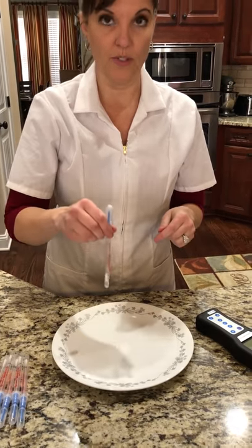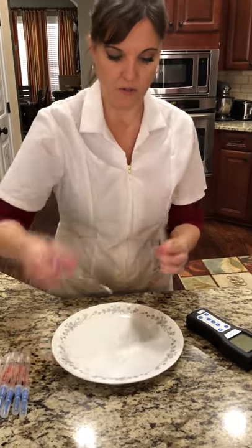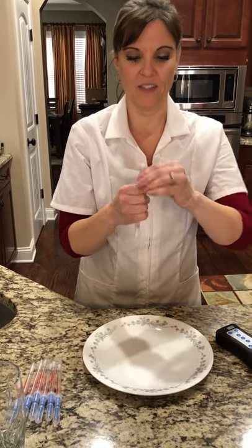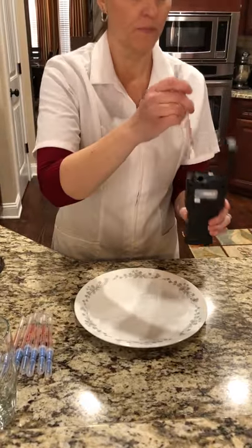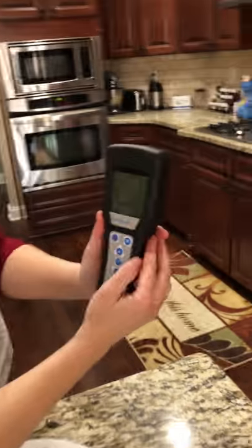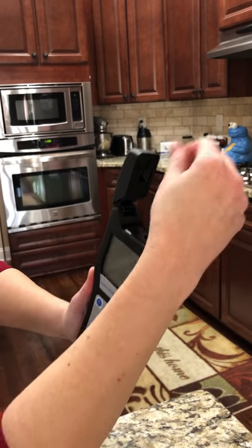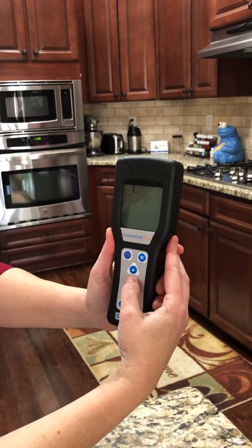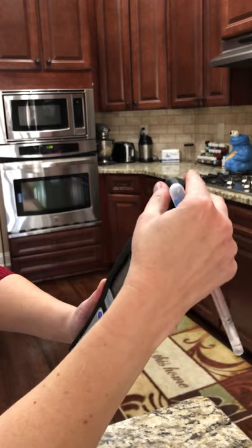So now we're going to test the plate after the raw chicken. One, two, three, four. Go ahead and activate it. We have to do five seconds of gentle swishy time. This is the straight raw chicken reading. The result is 259. That's actually really low — because I had 9,000 before. We just thawed frozen chicken that was pre-packaged and individually sealed. I'm shocked it's that low, and it's organic chicken.